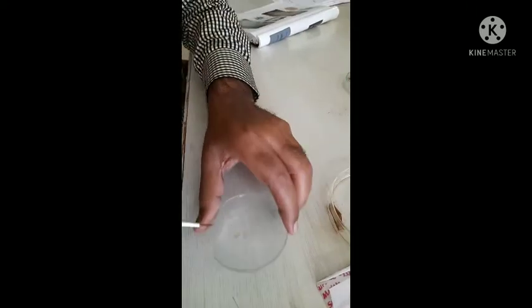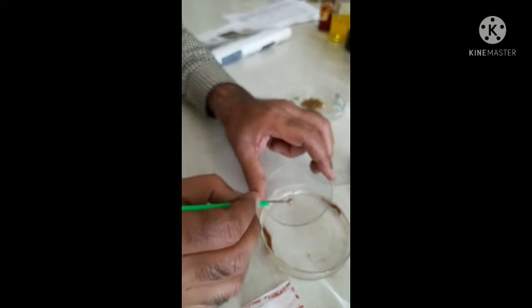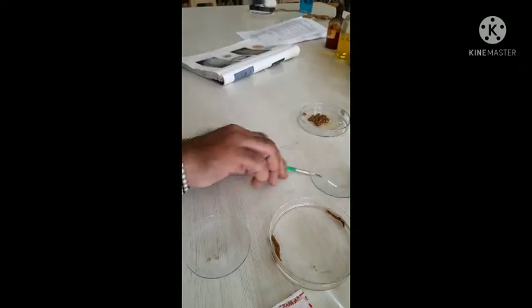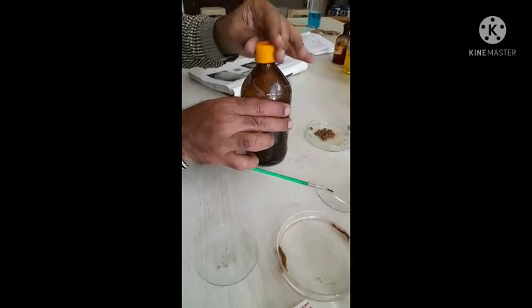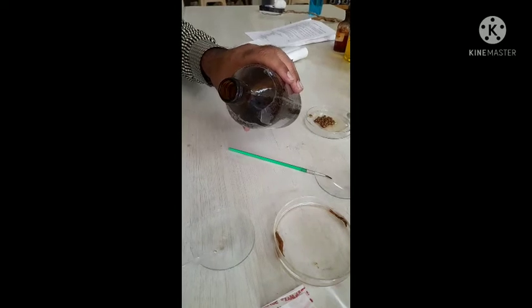We clearly observe this when we take a thin transparent section and observe under the microscope. The section is bleached with the help of bleaching reagent. We clean the section with water, remove the water, and then add hydrogen peroxide for bleaching. Bleaching is used to reduce the pigmentation from the section, making the tissue clear in appearance.